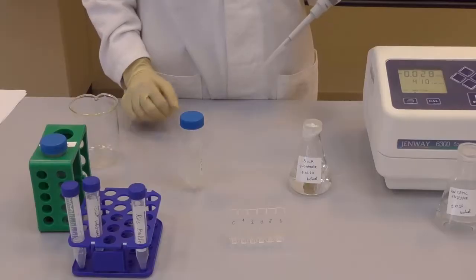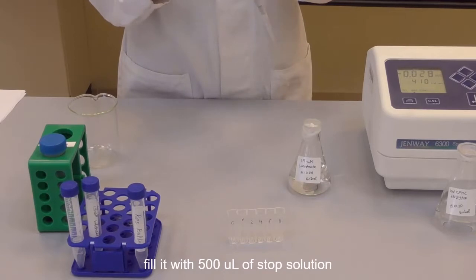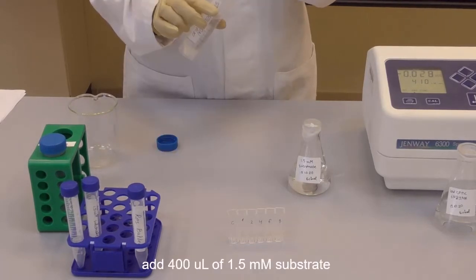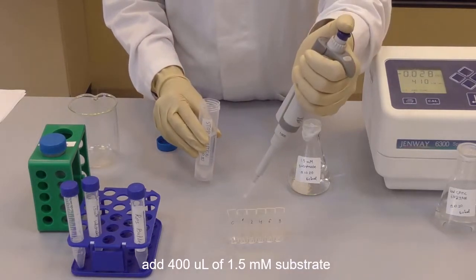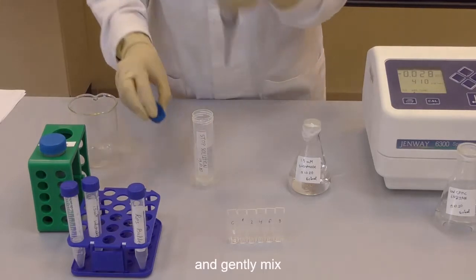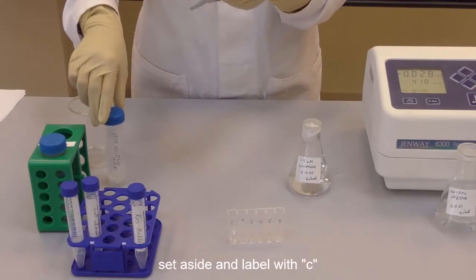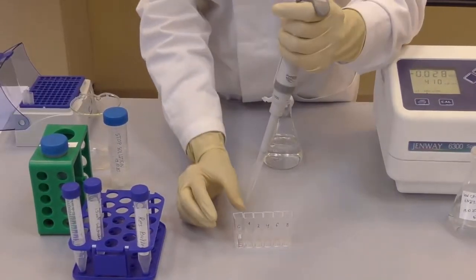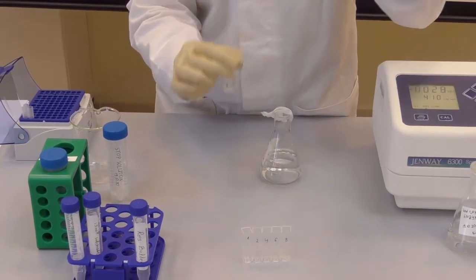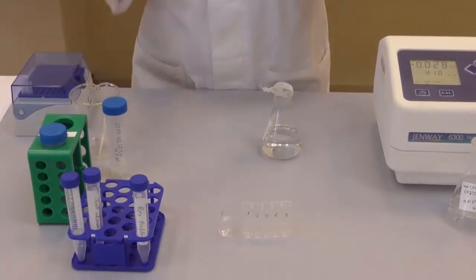Take the spectrophotometry cuvettes and fill one with 500 microliters of stop solution. Stop solution is a strong base. Add 400 microliters of 1.5 millimolar substrate and add 100 microliters of resuspension buffer. Gently mix and set aside, labeling it with the letter C. It is going to be our control cuvette for calibrating the spectrophotometer.